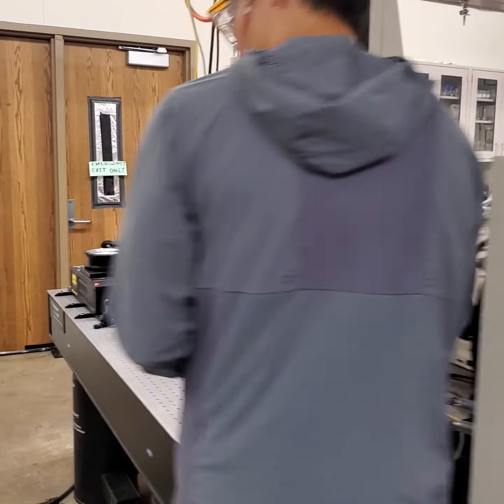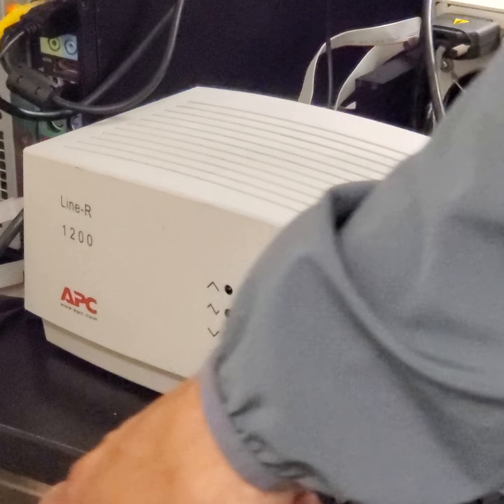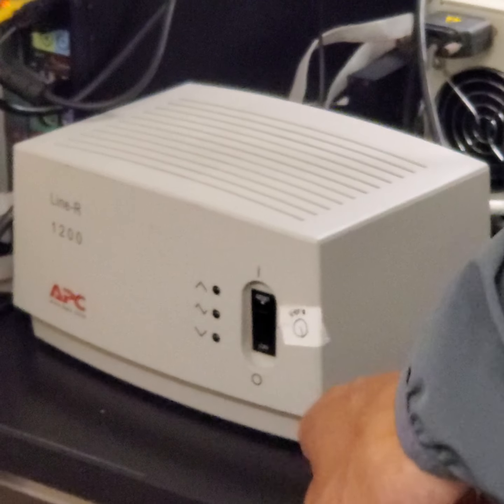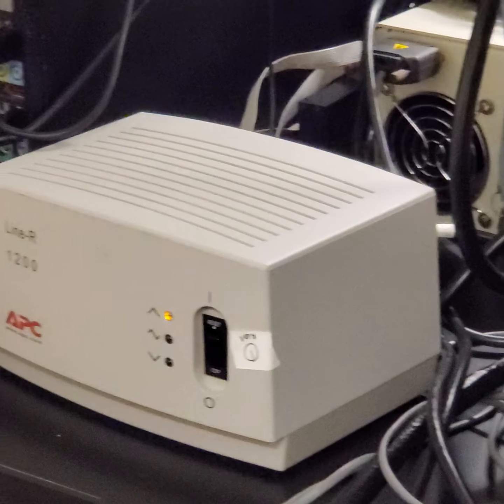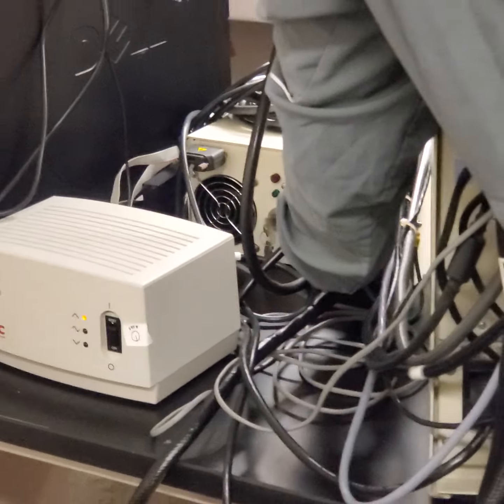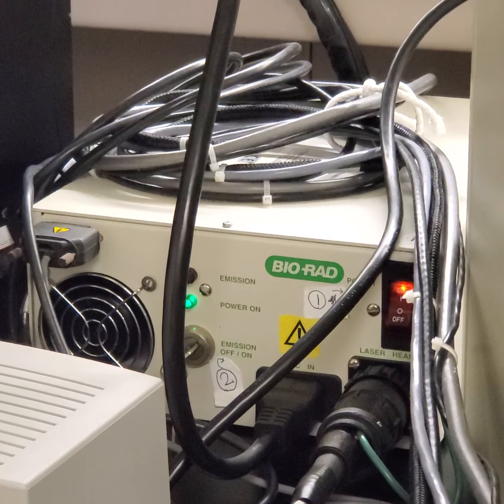Could you click from here? Yeah. So this is the power. So turn this on, right? So once you check there's no more blinking, then I can turn this laser on, the power on, and as you start the car, you move the key, right? Then you're beeping, right?